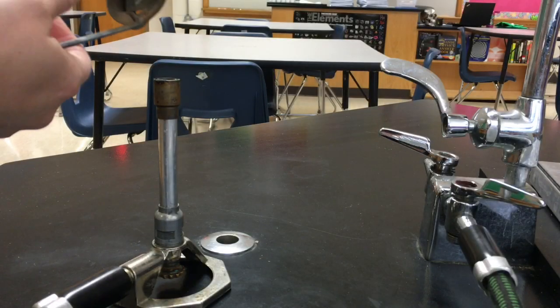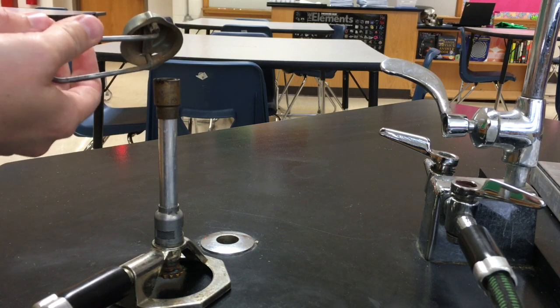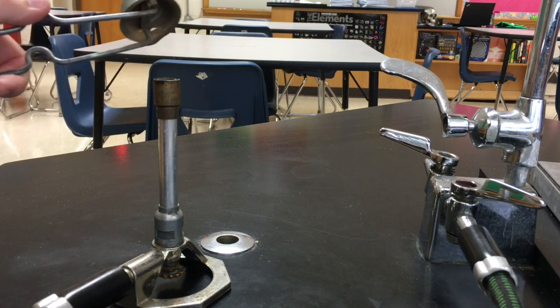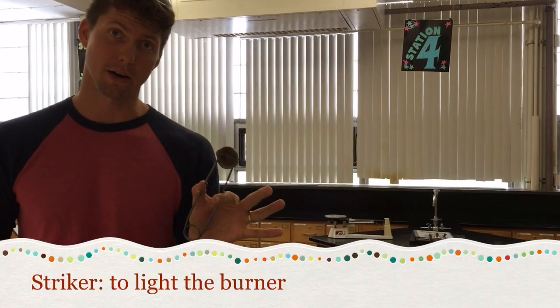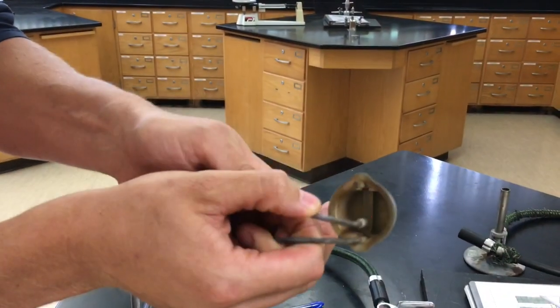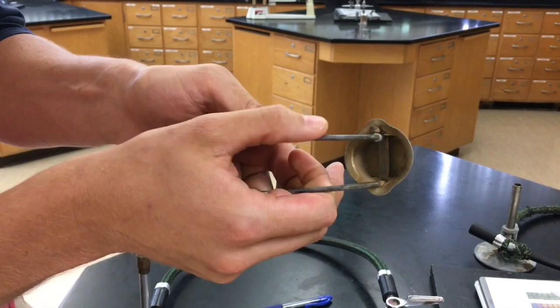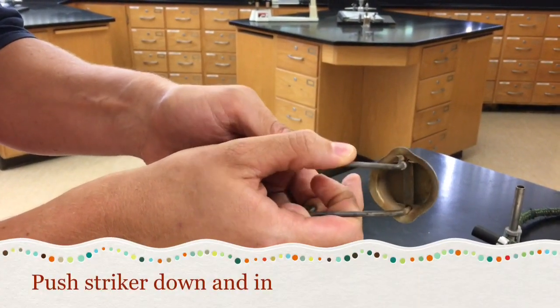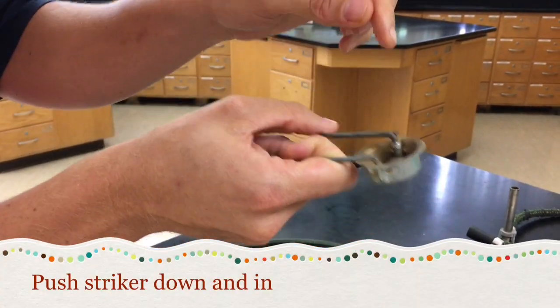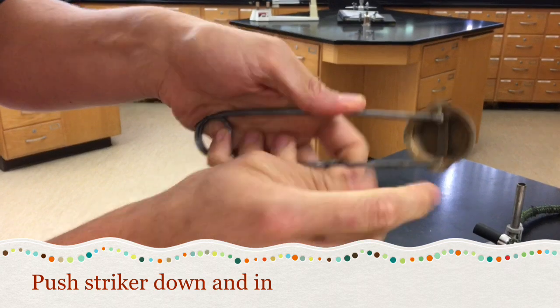Now I'm going to pass the video over to Mr. Milberg, who's going to teach you how to make a Bunsen burner flame. The first tool you need is a striker. To make a striker work, move it back and forth to create sparks. A lot of students won't push the striker enough and it doesn't create very many sparks.